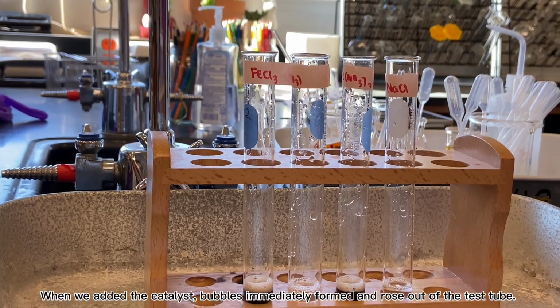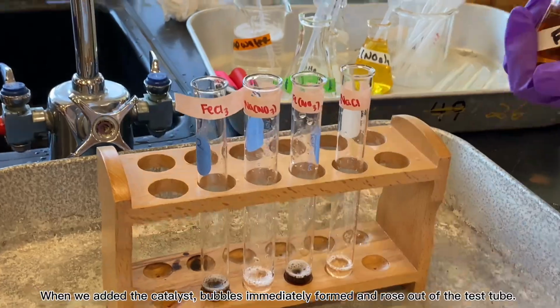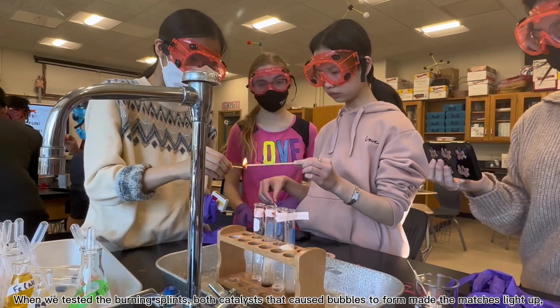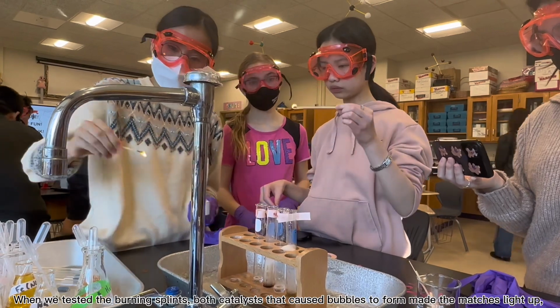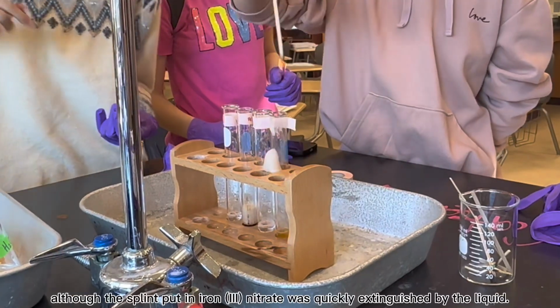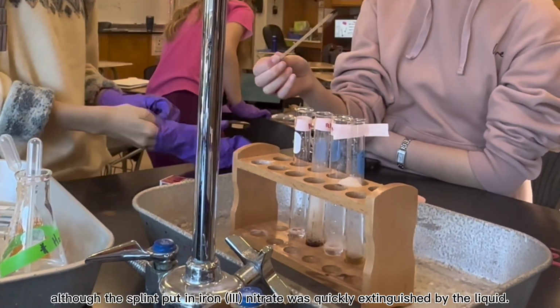When we added the catalyst, the mixture immediately turned a darker color and bubbles formed and rose out of the test tube very quickly. When we tested the burning splints, both catalysts that caused bubbles to form made the matches light up, although the splint put in iron 3 nitrate was quickly extinguished by the liquid.